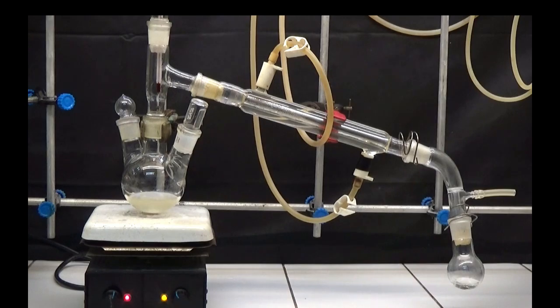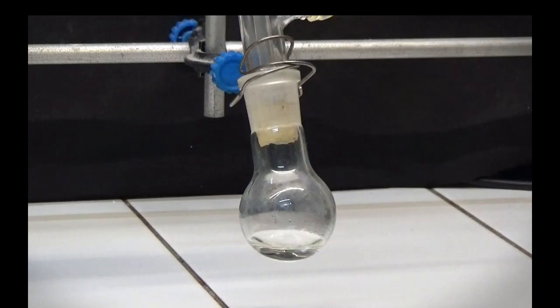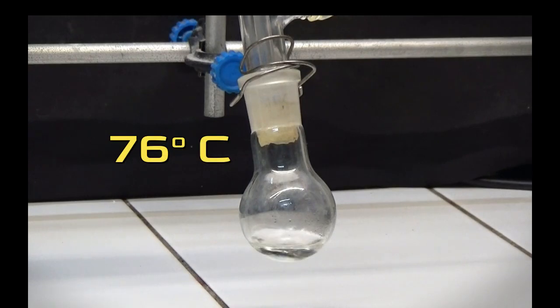After this time, install the distillation equipment and distill the thionyl chloride without the water bath until the temperature exceeds 80 degrees. The temperature of thionyl chloride is 76 degrees.